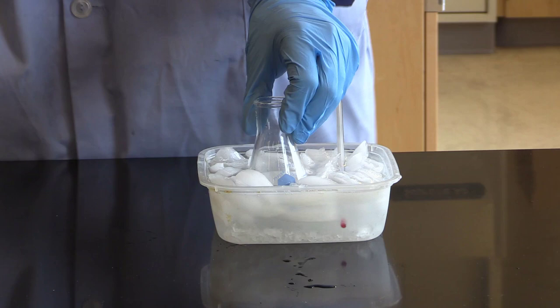While our reaction is cooling, we're going to set up the Buchner funnel to be able to filter out the reaction solution, so that way we're only left with our solidified aspirin.